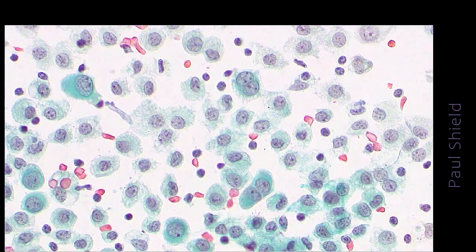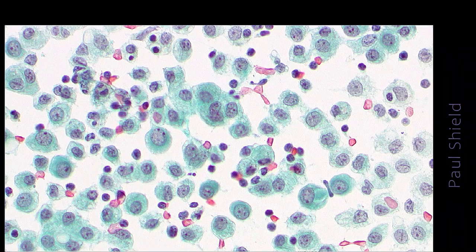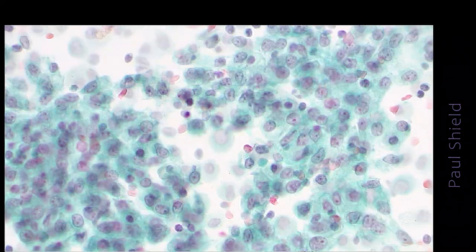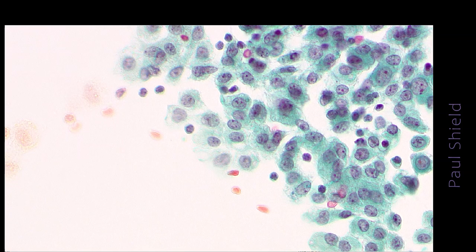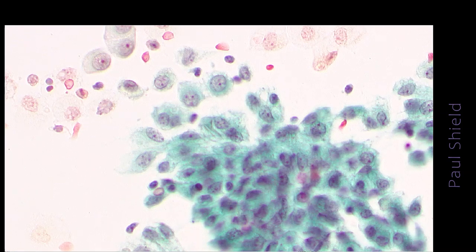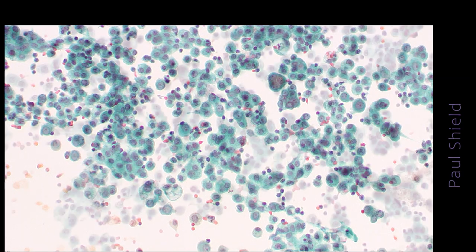This is a reactive case with a Pap stain. You can see fairly prominent nucleoli in just about all the cells here, a little more tendency towards grouping. Here you have more grouped-looking cells, and again they have quite a degree of uniformity, so pretty much all the same size and shape nuclei, same NC ratio.